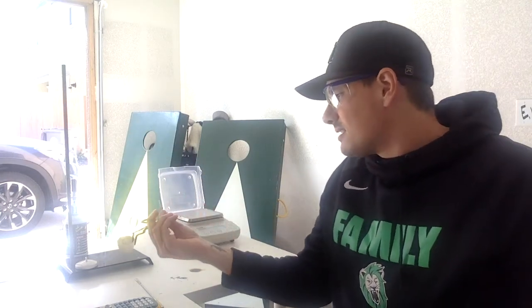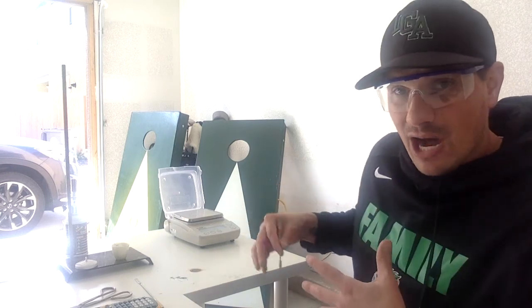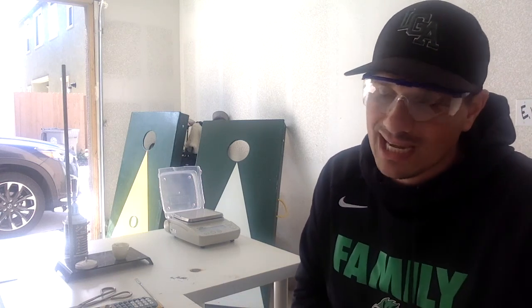Nice. And I'm going to let that sit down and cool for a little bit. We're going to let it cool to the touch. Once it cools to the touch, I can weigh it out. If it's hot, as it evaporates, that heat leaving is going to change the mass. So I want to wait till it's cool to the touch to get those masses down. Once I get those, I'm going to show you guys some calculations, and then we're going to call it good.